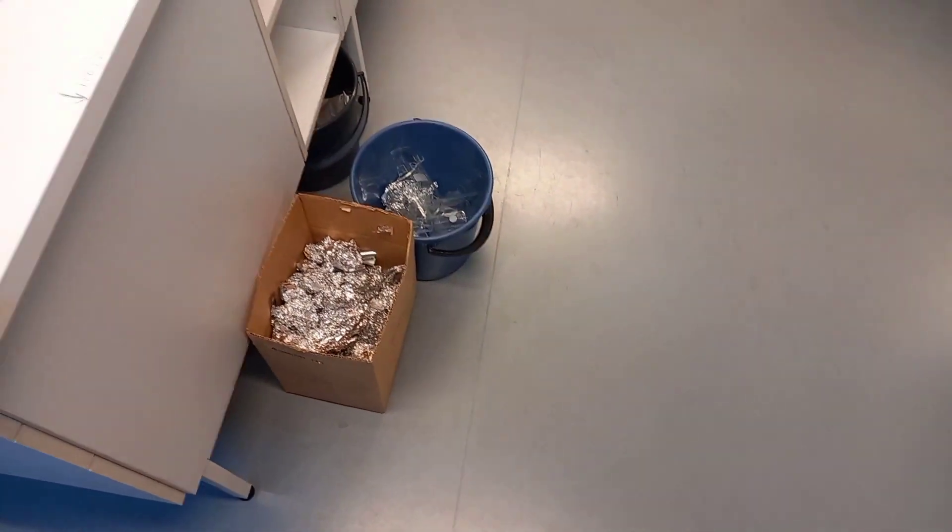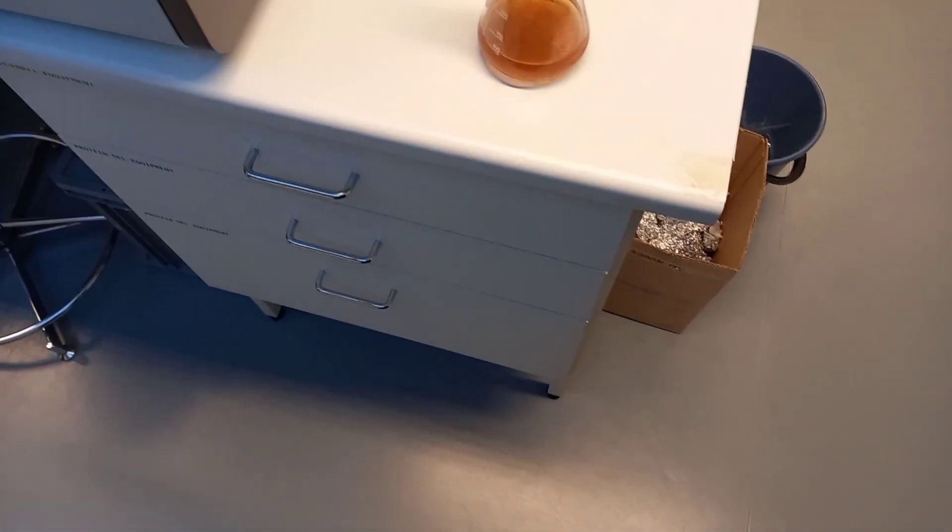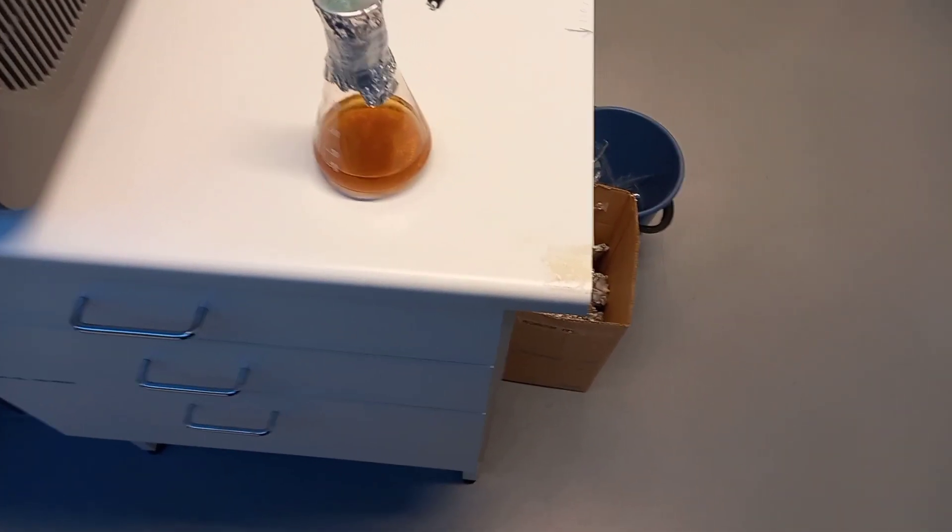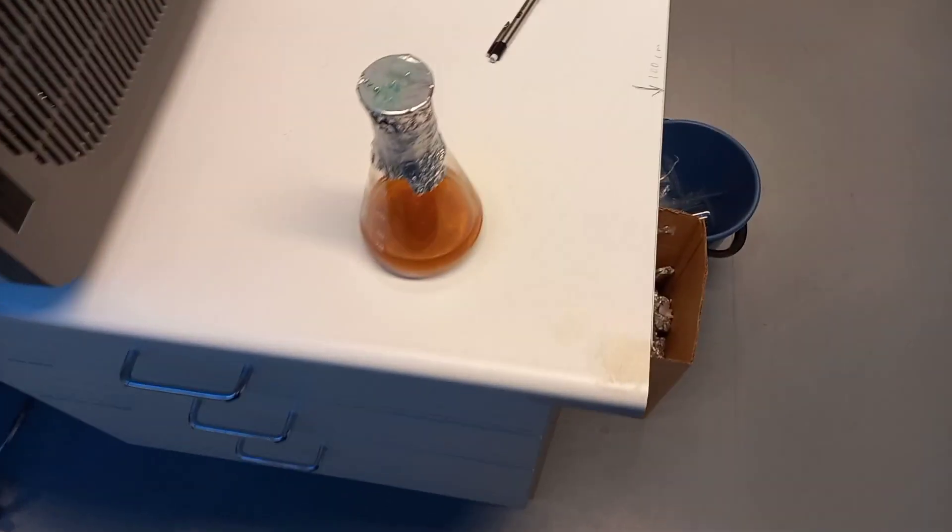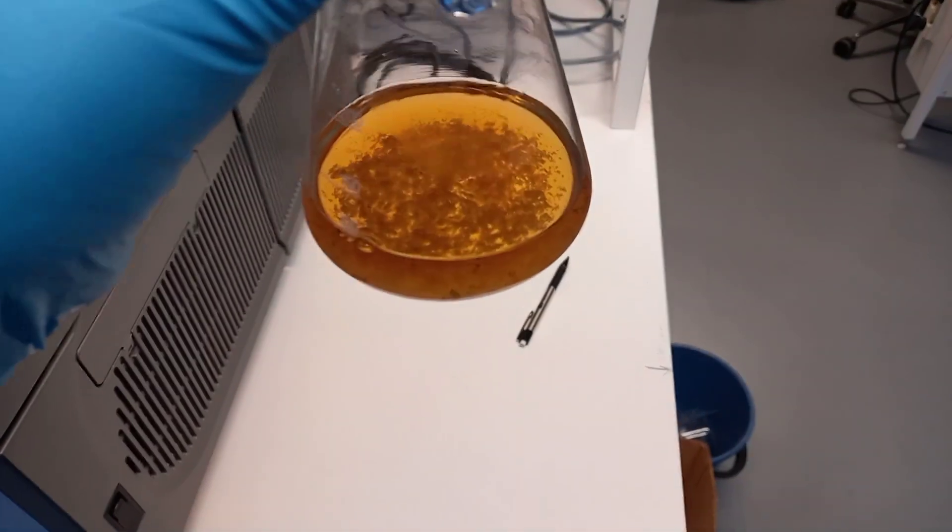Welcome to Fred's Lab at the University of Helsinki. I am showing you today the growth of Streptomyces species in liquid medium. This species is very important—it is a gram-positive bacteria and provides over two-thirds of the clinically useful antibiotics of natural origin that we use in medicine.